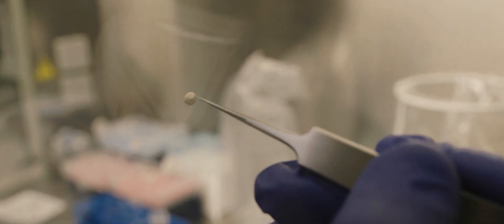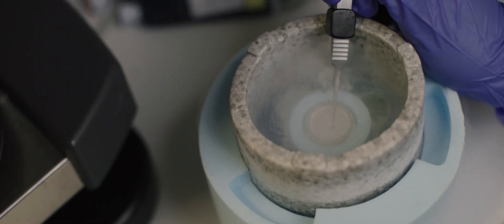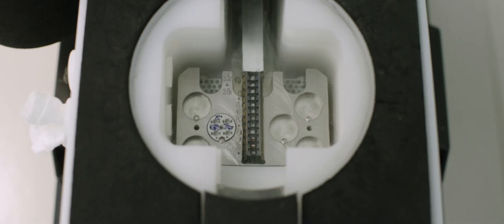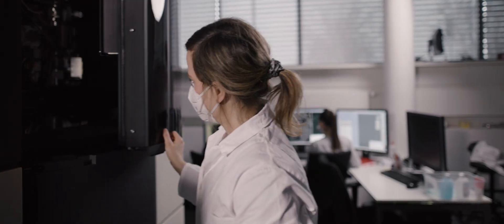Before the EM grids can be loaded into the cryo-electron microscope, they have to be clipped into a so-called autogrid. It's a supporting copper ring, and the grids are placed in a cassette. The cassette is then transferred into the electron microscope, where an automatic device takes the individual grids from the cassette and puts them into the EM column, where the grids are then imaged.